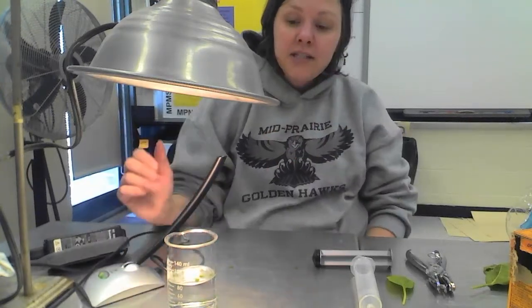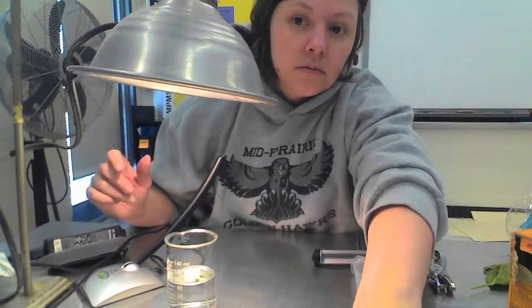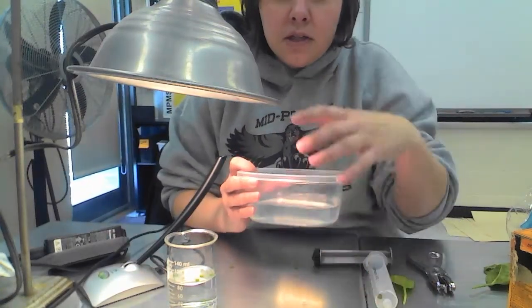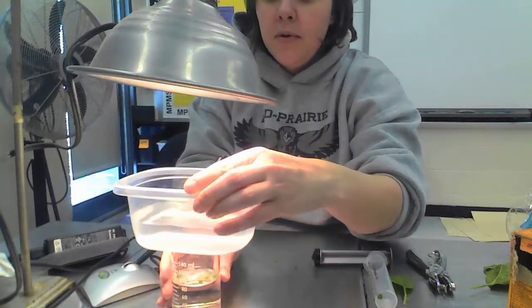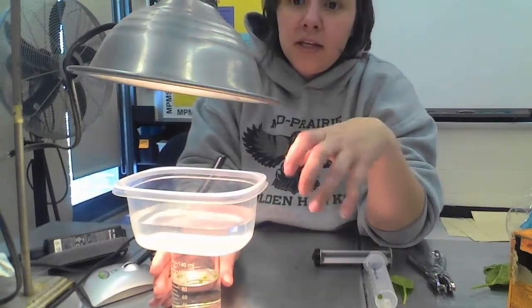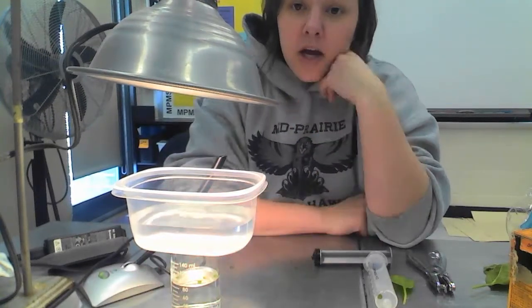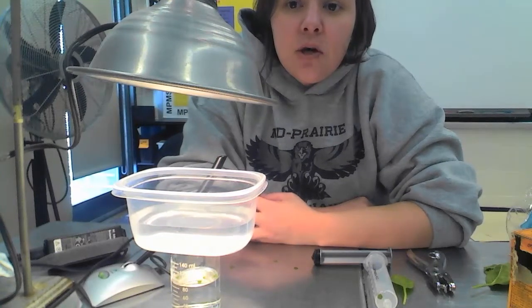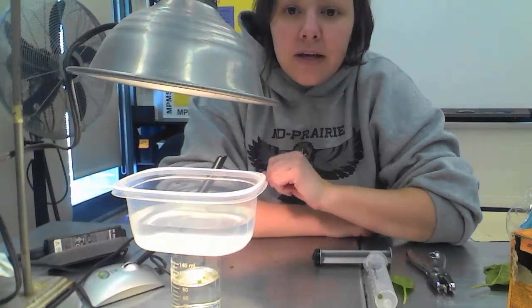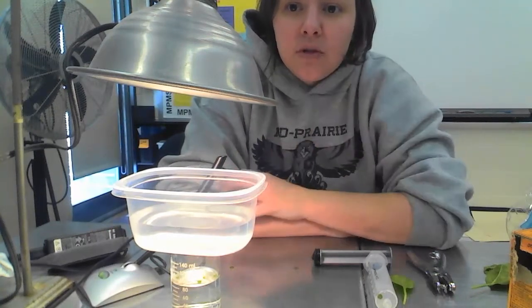So you may need to put a container of water over it. If you notice, I have a container of water that I'm going to sit right on top, which is going to absorb all the heat but allow the light to pass through. That way it can protect the leaf. We're going to fast forward so you can see what actually happens. Make sure you have these lab directions written down, and we'll see you tomorrow.